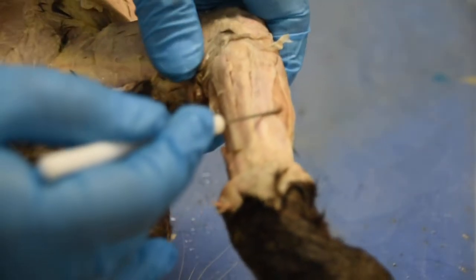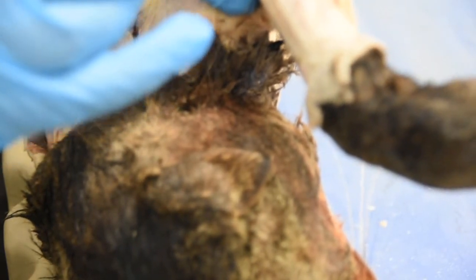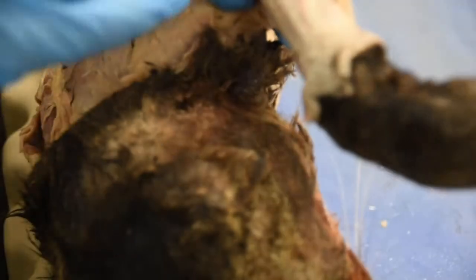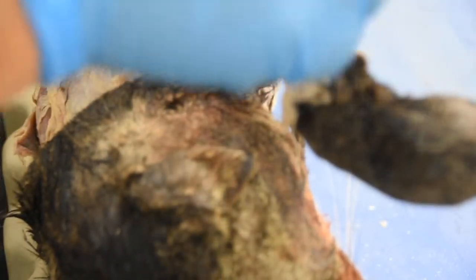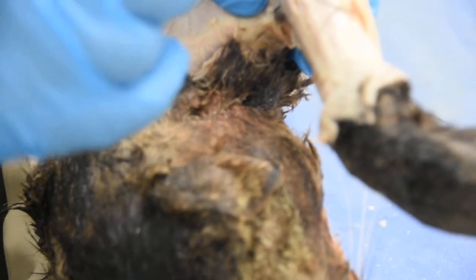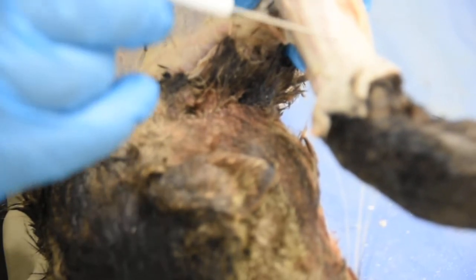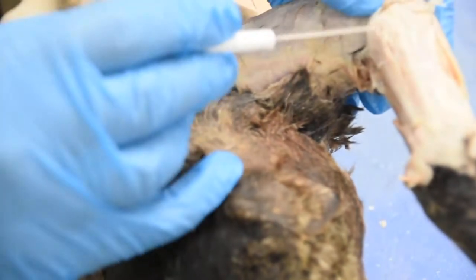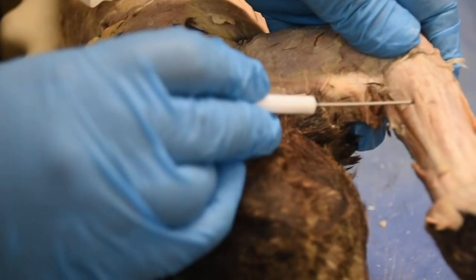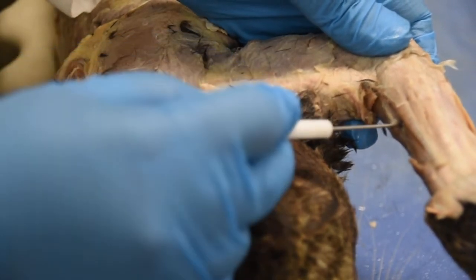If you turn this cat around, right next to that, you will see your flexor carpi ulnaris on the flexor side, which makes sense because flexors are going to be on this side and extensors on this side. So one more time, this is your extensor carpi ulnaris, extensor digitorum, extensor carpi radialis brevis, extensor carpi radialis longus, and then brachioradialis.